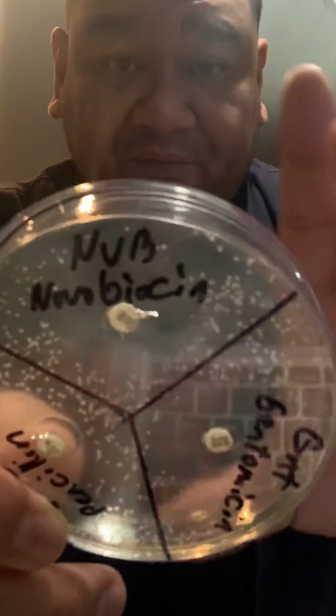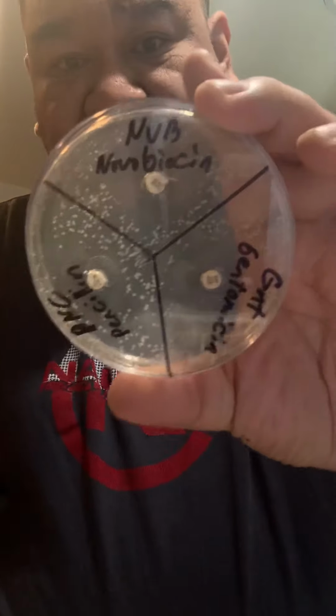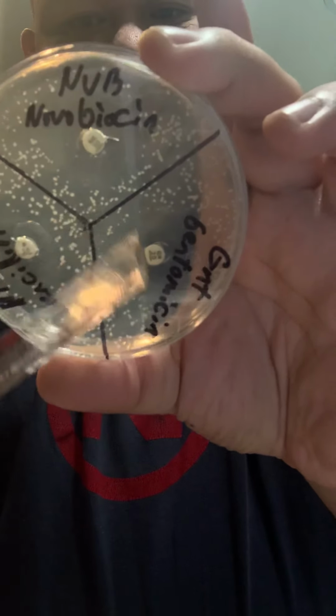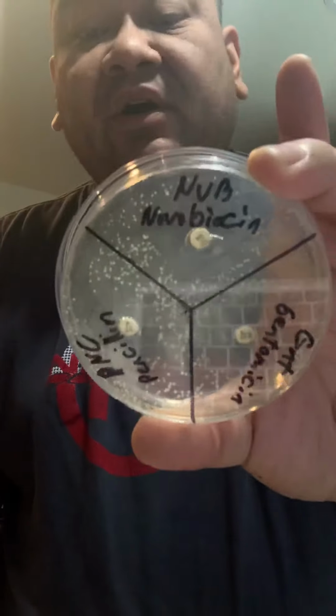So these are the results I expected, where in the middle there'll be a lot of microbes, and with the antibiotics it slowly kills them, spreading little by little, and this is the result I was able to retrieve from it. As you can tell, there's a lot of microbes right here where the lines are, at the borders, and in the middle of the circle. But within, there isn't that much, because the antibiotics was placed in there.